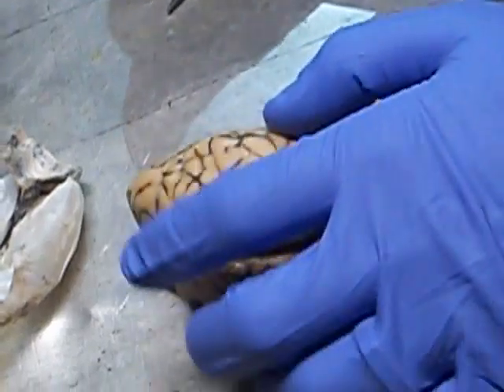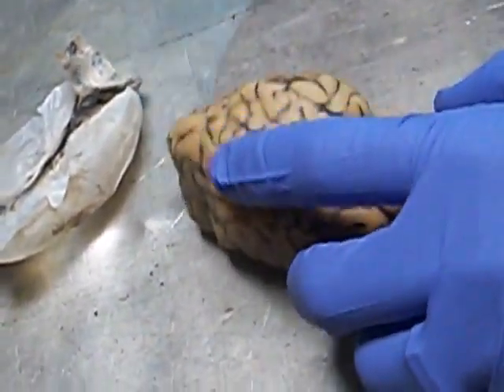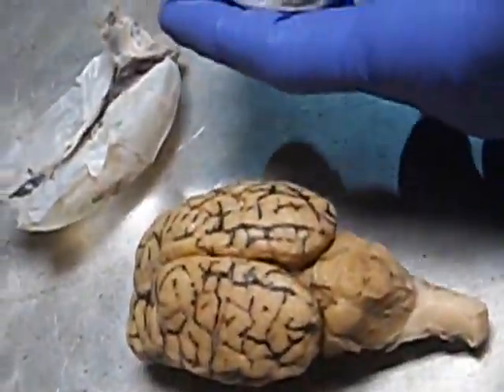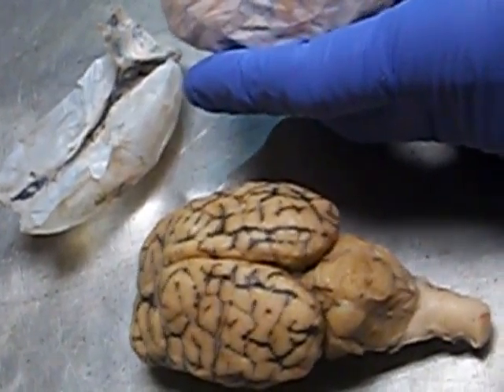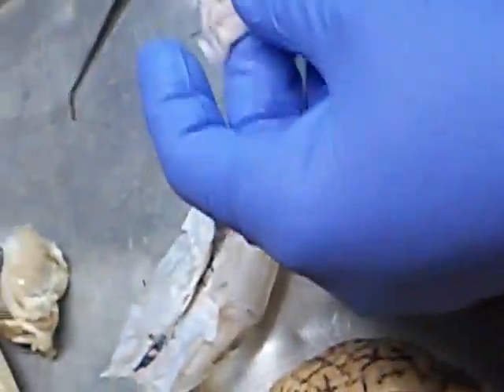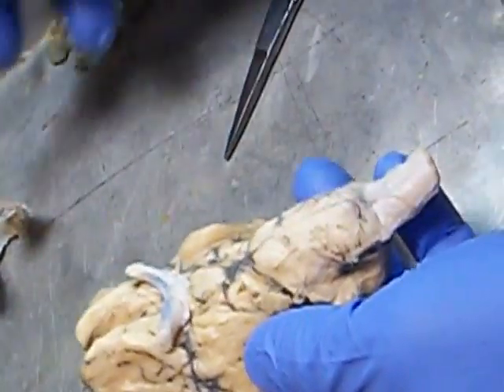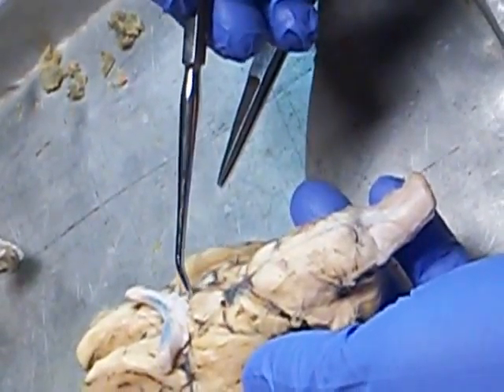All right. So here's what we're looking at. When you're looking at the brain itself, the one thing that I removed when I was removing the meninges, and oftentimes pops off, is this gland right here, so you've got to spend some time carefully dissecting around it. Here's the pituitary gland. You can see the pituitary gland sitting right here now, but where it's actually sitting on the brain is right in this location. There's a little connection that connects the pituitary gland to this area right here.